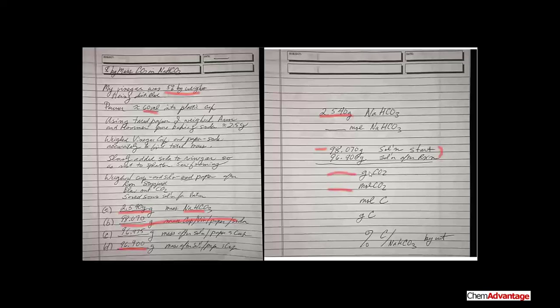There we go. And divide that mass by the molecular mass of CO2, you get moles of CO2. And here's the real secret for the experiment, because there's just one carbon in carbon dioxide. So if we had 15 carbon dioxide molecules, we'd have 15 atoms of carbon. So if you had 0.01 moles of CO2, you'd have 0.01 moles of carbon. And from that, you can find the grams of carbon. And that's it. That's almost the end of our experiment.